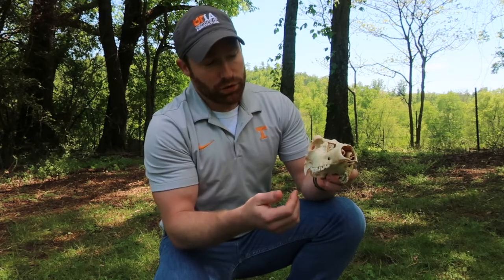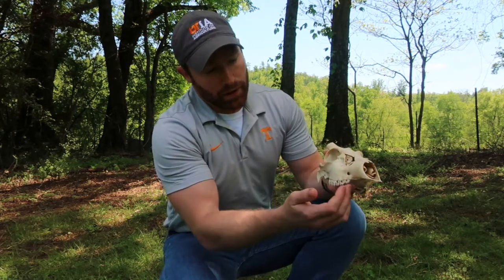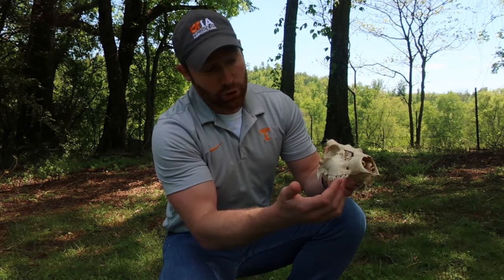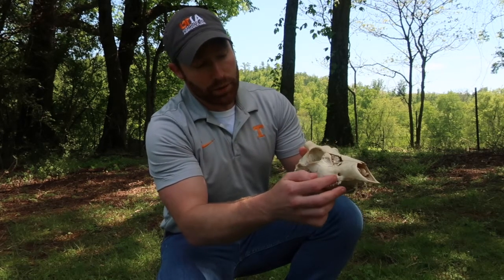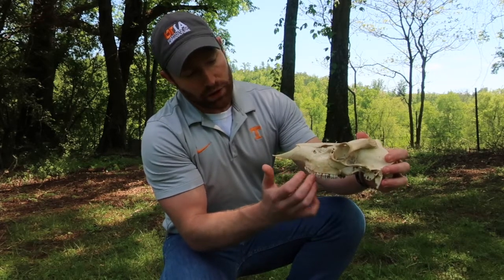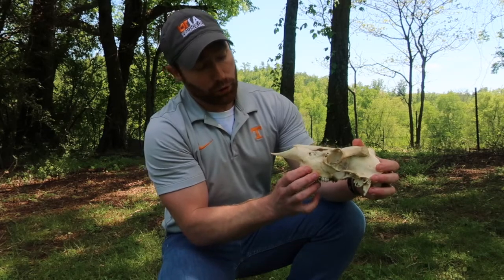these molars. Also interesting about this animal is that it is a young animal. You can see that these are actually baby teeth, sometimes called milk teeth or deciduous teeth, because you can see the more adult-like teeth coming in up at the top here. They're adult teeth that are starting to move in. And so these front molars here will eventually fall out and be replaced by these adult or permanent teeth.